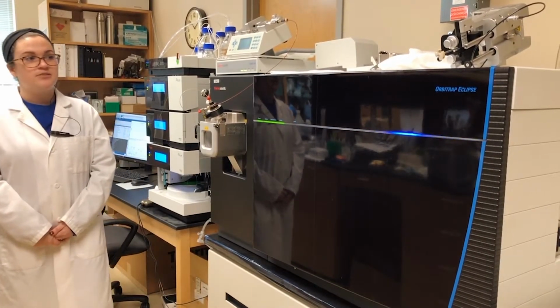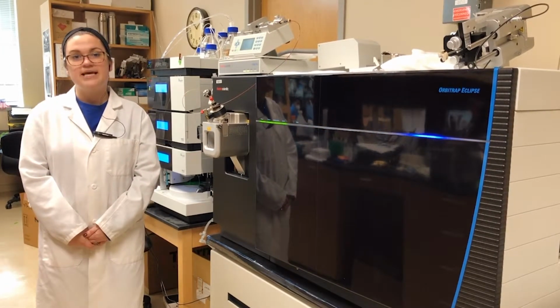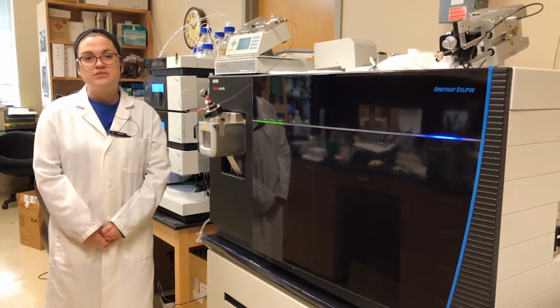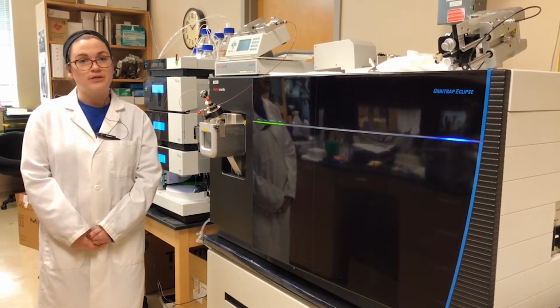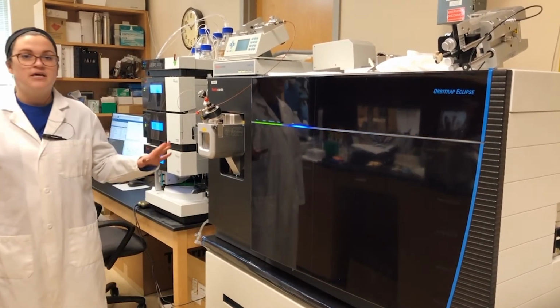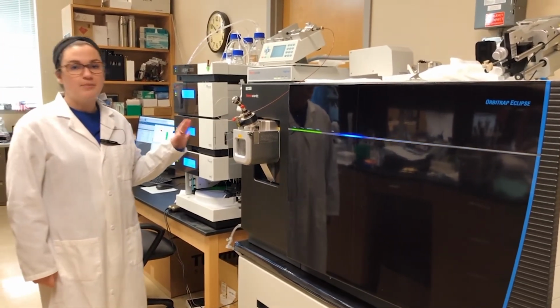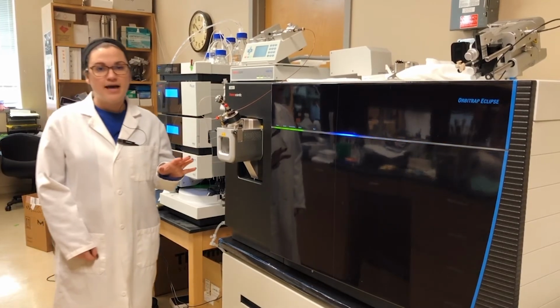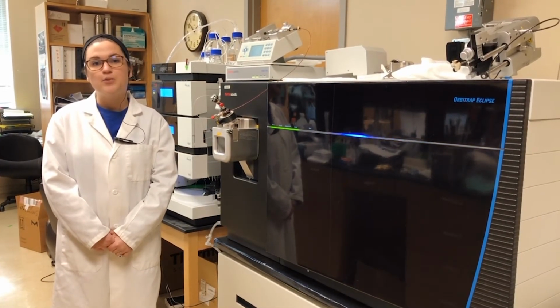And so to any experiment, we can also add what's known as FAIMS, and FAIMS stands for High Field Asymmetric Waveform Ion Mobility Mass Spectrometry. And FAIMS uses ion mobility characteristics to funnel compounds based on their unique properties. So we can add FAIMS to any experiment, including an LCMS experiment. And when we do that, we are able to get 2 different levels of separation, first on the LC end and then on the ion mobility end. And this would help us to characterize even the most complex glycopolymer mixture.